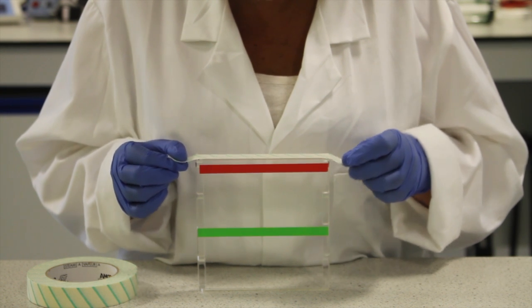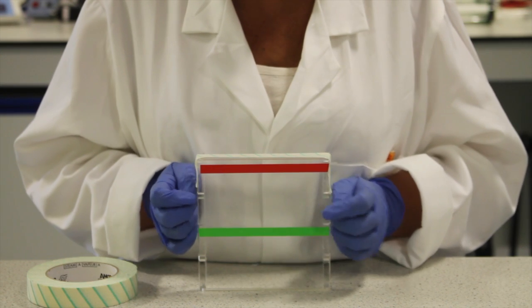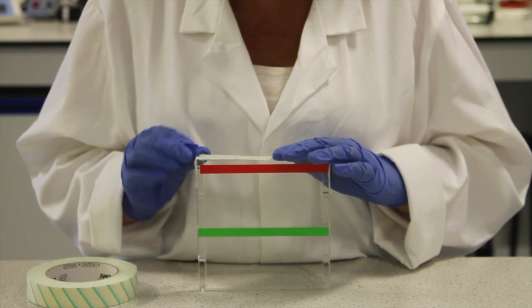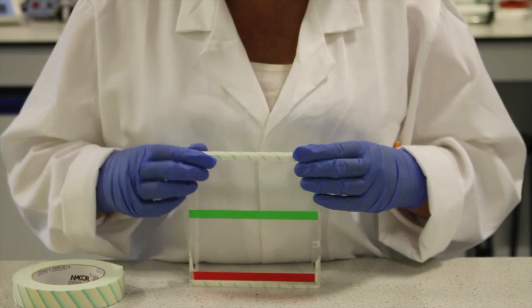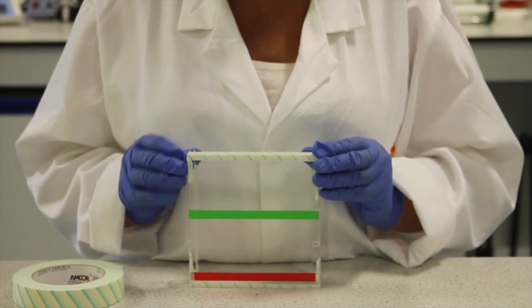Ensure that some excess is taken around the edges to give a good seal. Press along the edges firmly to ensure a tight seal all round. Repeat this process along the other open edge.